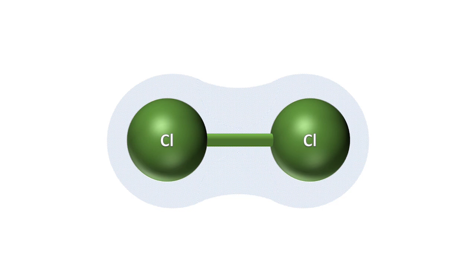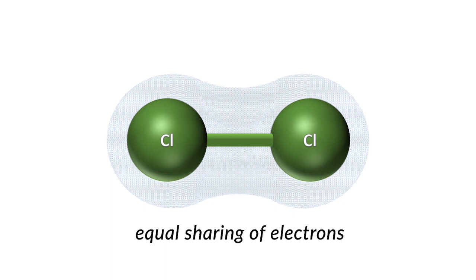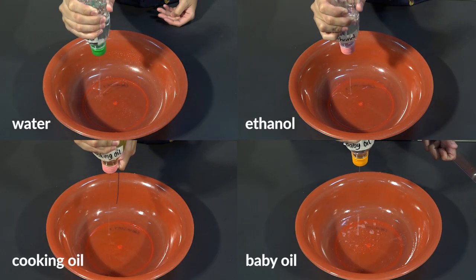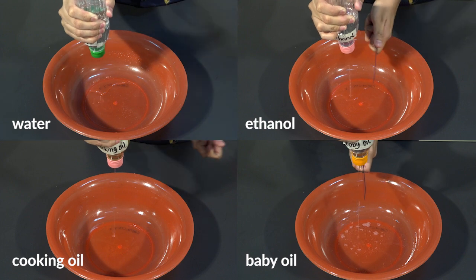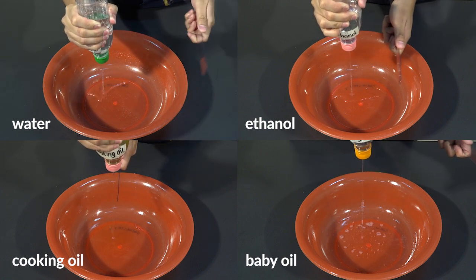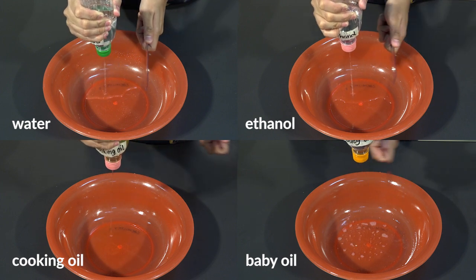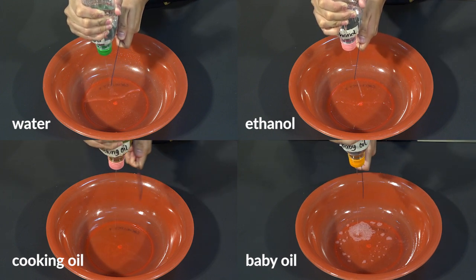Its two chlorine atoms have the same electronegativities and have equal sharing of electrons. Thus, the chlorine molecule has no net dipole moment and is nonpolar. Now, let us proceed to the second part of your activity, where you identified the molecular polarity based on the observed behavior of the liquid towards a charge ruler.